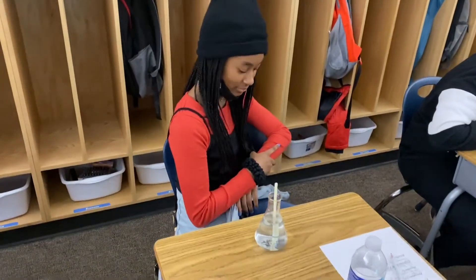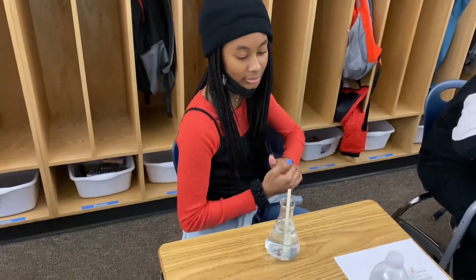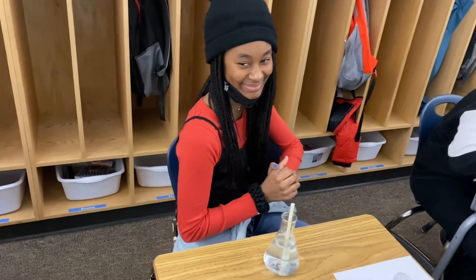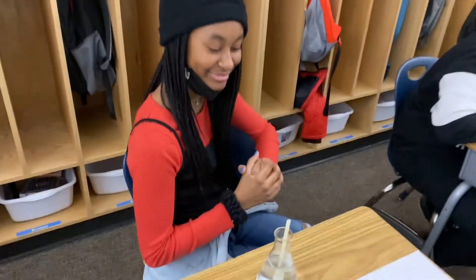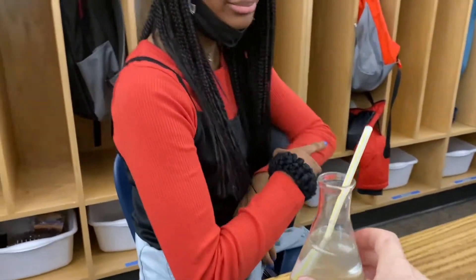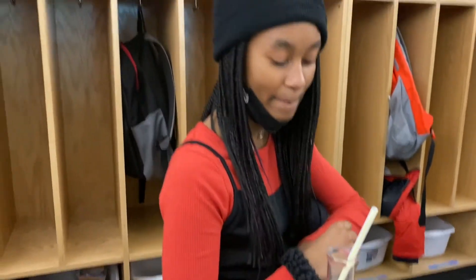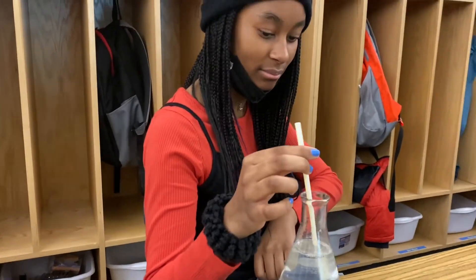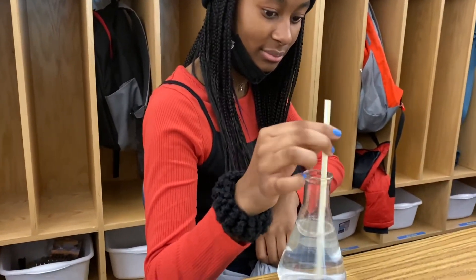I'm here with Sequoia and she's got some lime water that she's going to add carbon dioxide from her lungs to. We want to see if it changes into calcium carbonate — if it changes color.